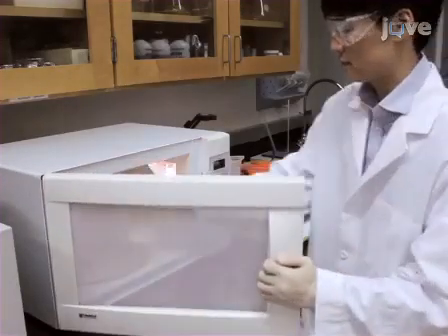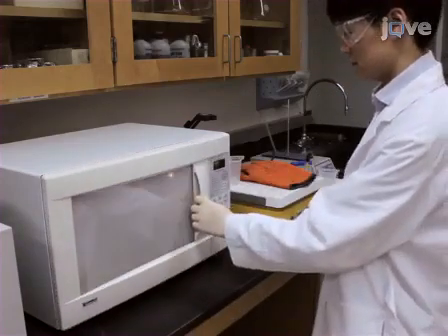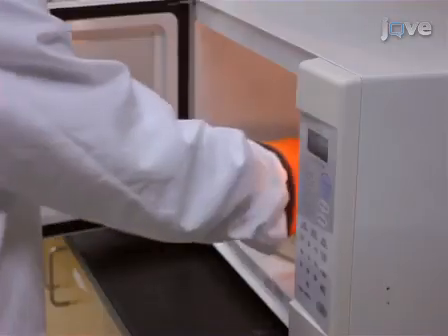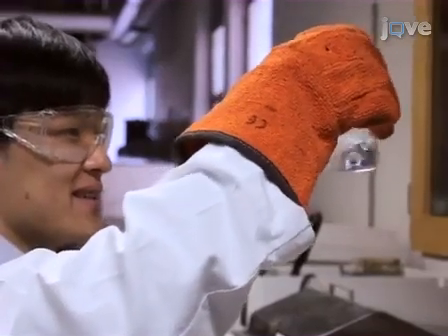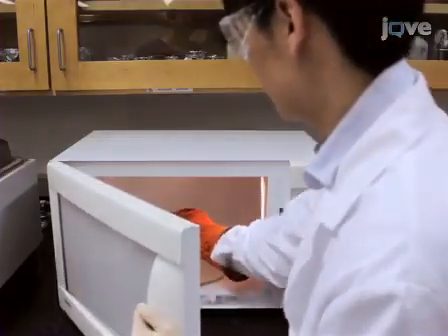Melt the agarose buffer mixture by heating in a microwave at maximum power. At 30-second intervals, remove the flask and swirl the contents to mix well. Repeat until the agarose has completely dissolved.